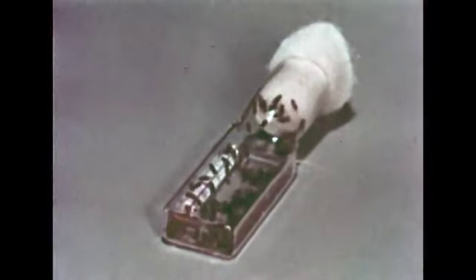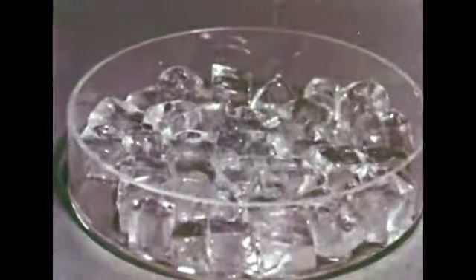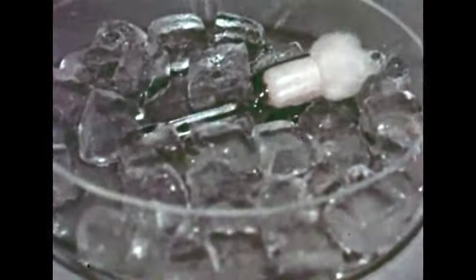But room temperatures may vary. Let's see if we can determine at precisely what temperatures the fruit flies are most active. This flask contains a centigrade thermometer. Now the flies are still active. But watch. Read the temperature and see if the activity of the flies changes.